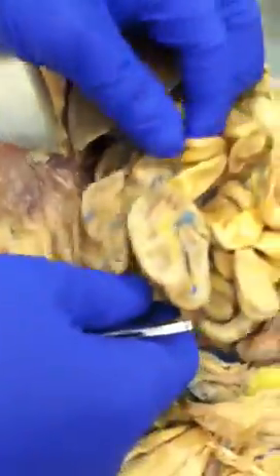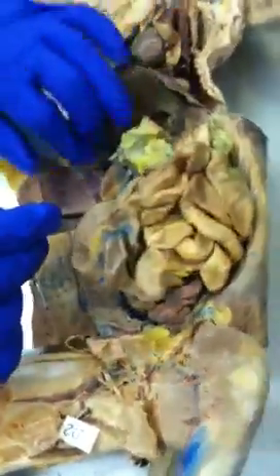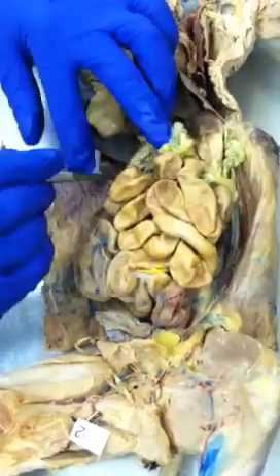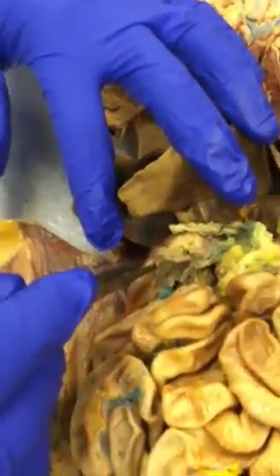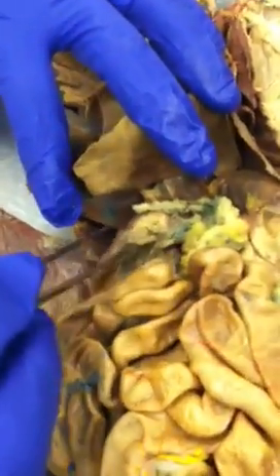And then somewhere the jejunum will start, and maybe if I put a pin over here, for instance, like somewhere in the middle here, then that's the jejunum, right? All right. The pin for the duodenum, I would put right close to the stomach. If I put a pin right here, to say what's that part of the GIT, which is the gastrointestinal tract, and then you say duodenum.